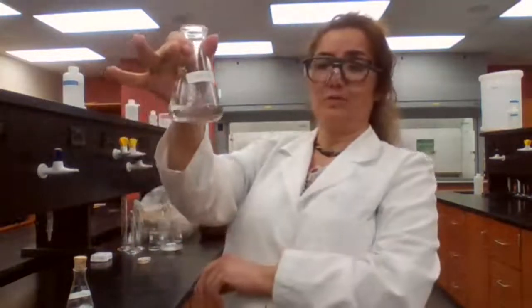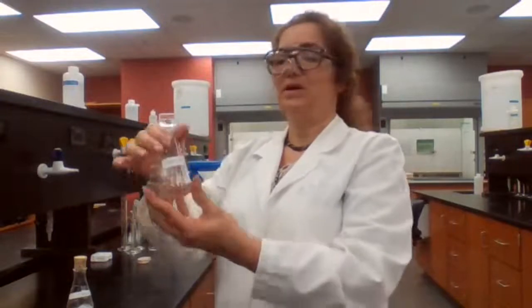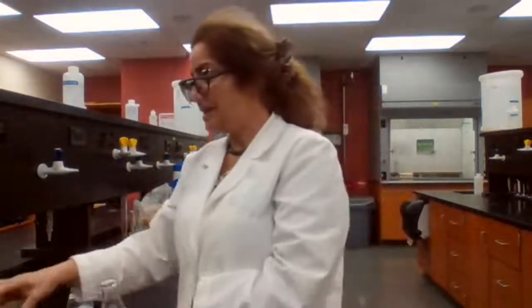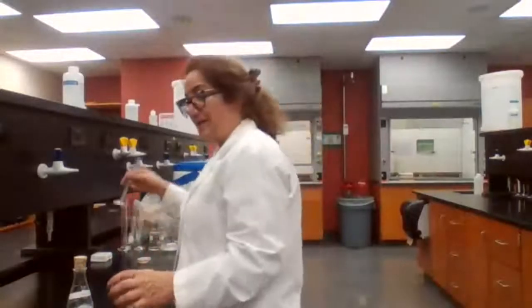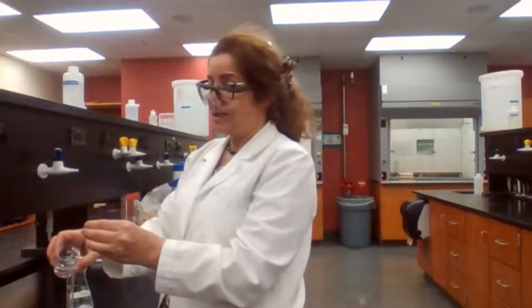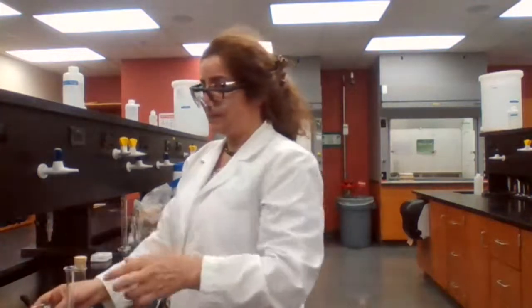Acids are more soluble in basic solution, but they are not soluble in acidic solution. So my carboxylic acid now in a basic solution is in soluble form. It is soluble, but when I add acid to it and change the pH to acidic, the carboxylic acid is not going to be soluble, and we will see a precipitate coming out. When you see the precipitate, then we are going to practice what we learned from the crystallization experiment last lab. How much HCl should I add?